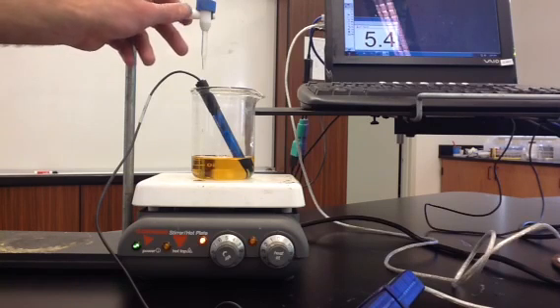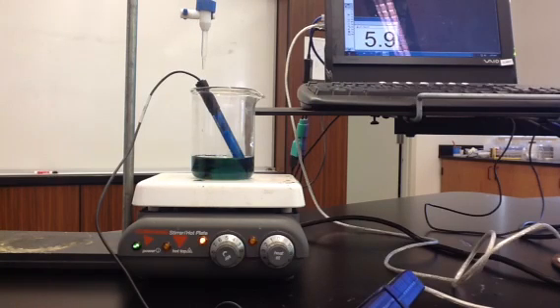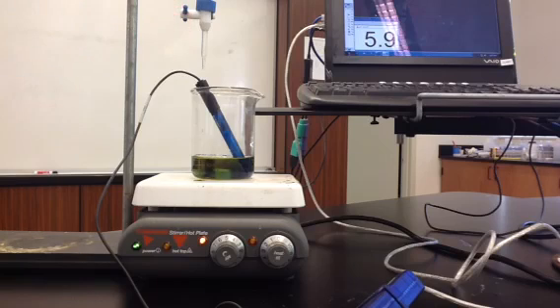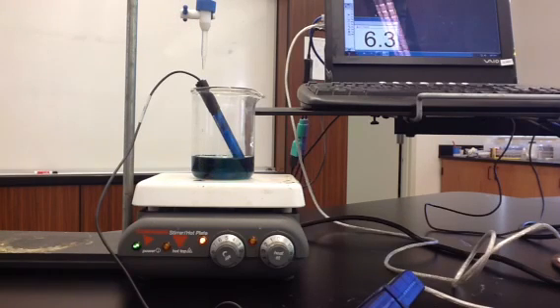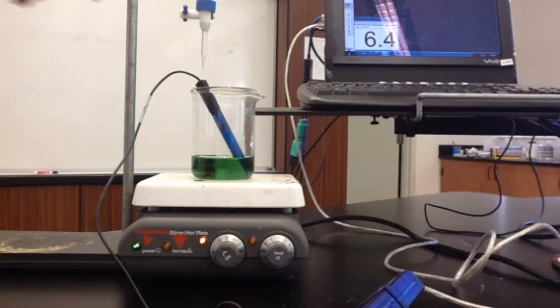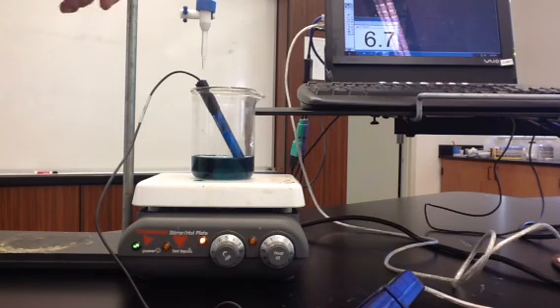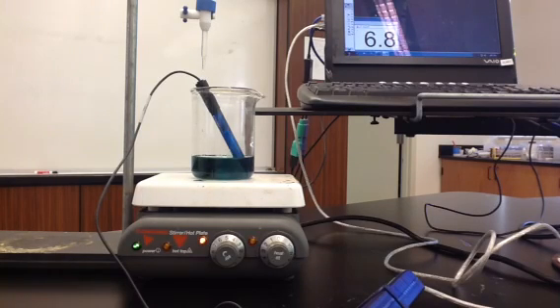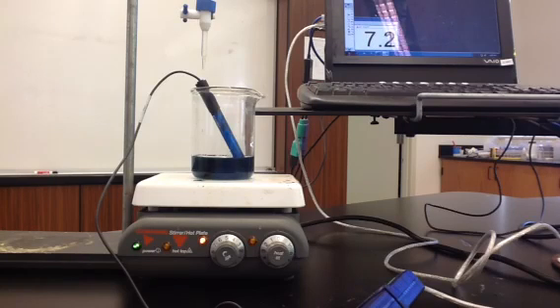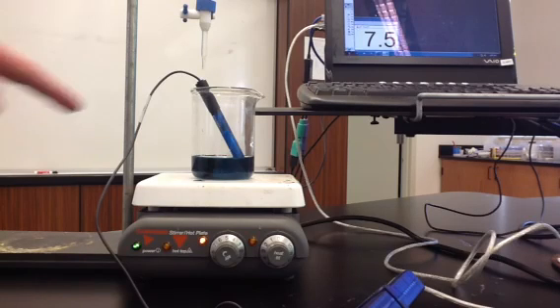I'll try to add less than a milliliter this time — just a very small amount. So now we're at about 18.2 milliliters, and we see the color has changed again. At 18.6 milliliters of base, we have a different color and our pH is now 6.4. We're at 18.9. Now at 19 milliliters of base, our pH is now 7.4. Our solution is kind of a blue-green color.